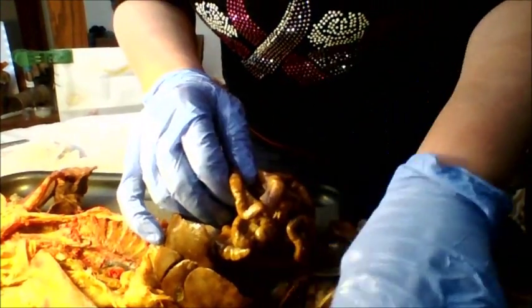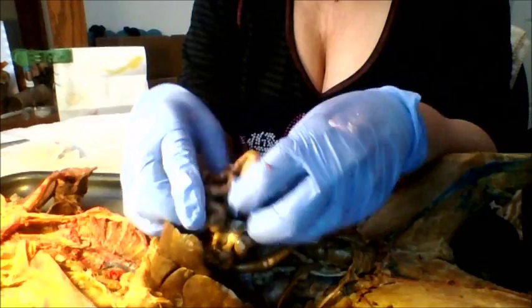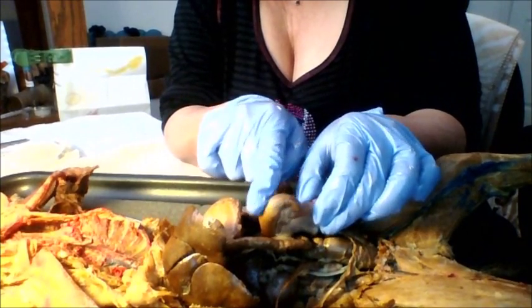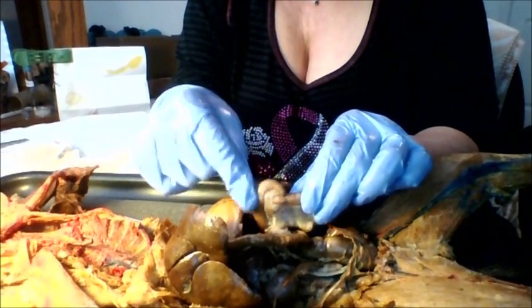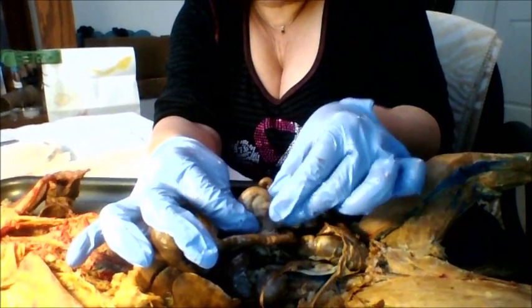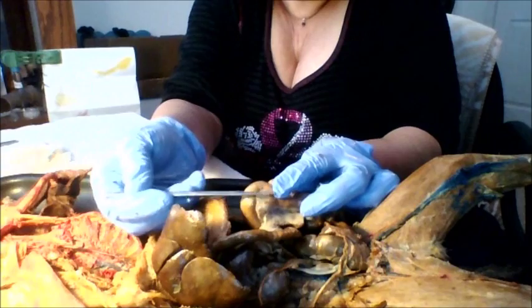It also keeps the intestines close together so they don't flop everywhere. If we follow all the way to the end, and I can tell we're at the end of the small intestine because we come to this larger intestinal looking piece. It's a C shape, and they don't quite match together like they're one solid piece. You can tell that the small intestine ends and the large intestine begins. It's got the tip over here, and the small intestine comes in this way.